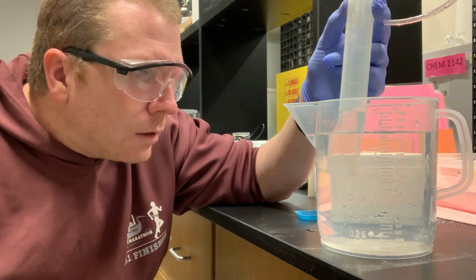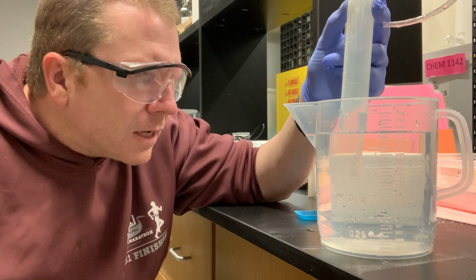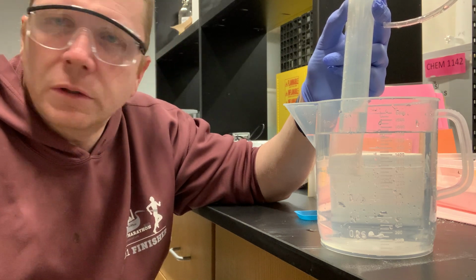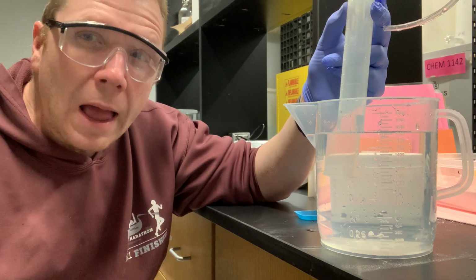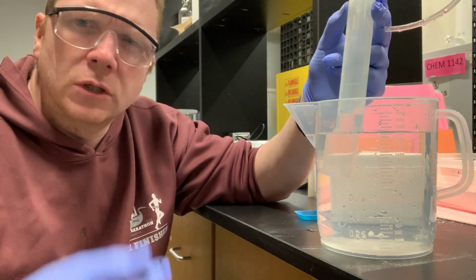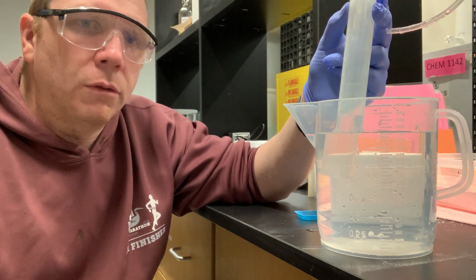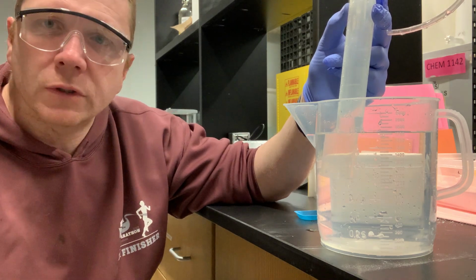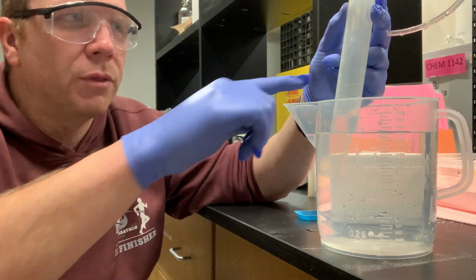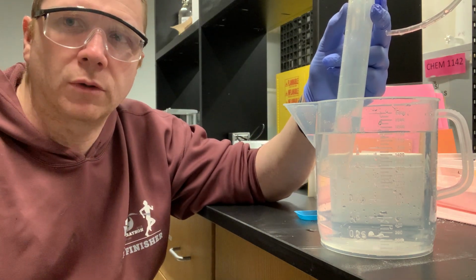So now I can read that my volume is approximately, that would be about 87 milliliters. So that means that the gas I just produced was around 43 milliliters. So with 0.2 grams of sodium bicarbonate and with 10 milliliters of 1 molar HCl, that's what I produced. All right, so that difference there is going to be the volume of the gas that you actually produce from this reaction.